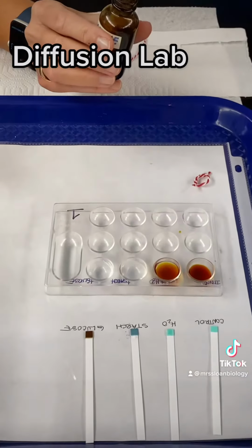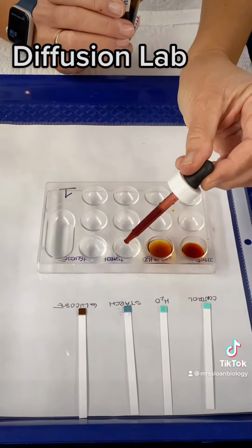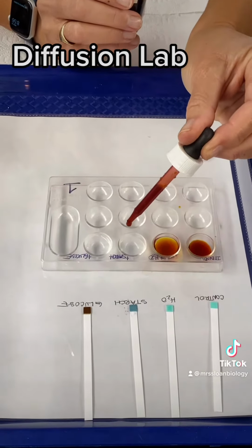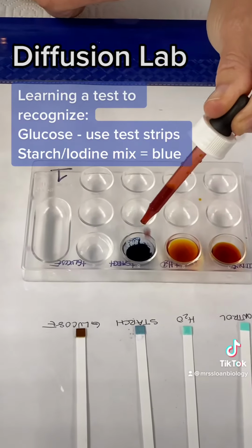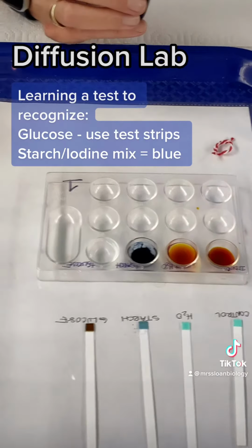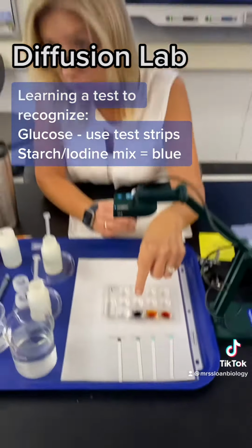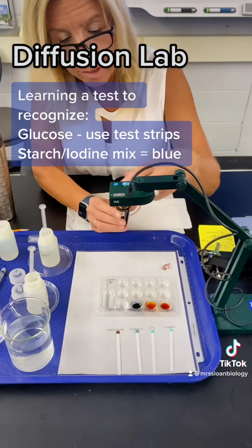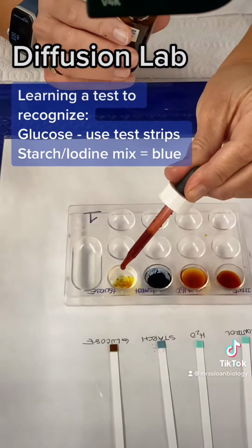Okay, and now, thank you. And now we're going to put it on starch. Can everybody see the camera? Okay, watch. Whoa, what's happening? It's like clumping in the middle. Yeah, so when iodine mixes with the starch, I know from your end it probably looks black, but it's a very, very dark blue. And then here, we'll add it to some glucose.